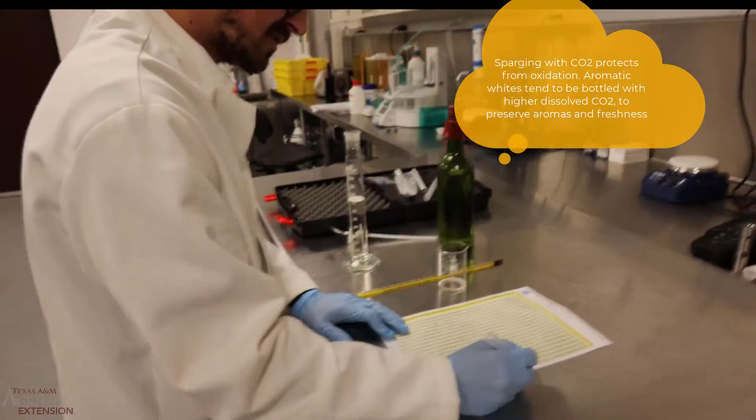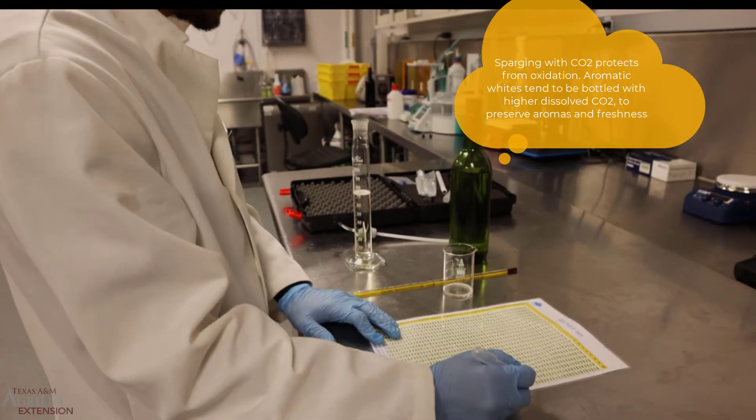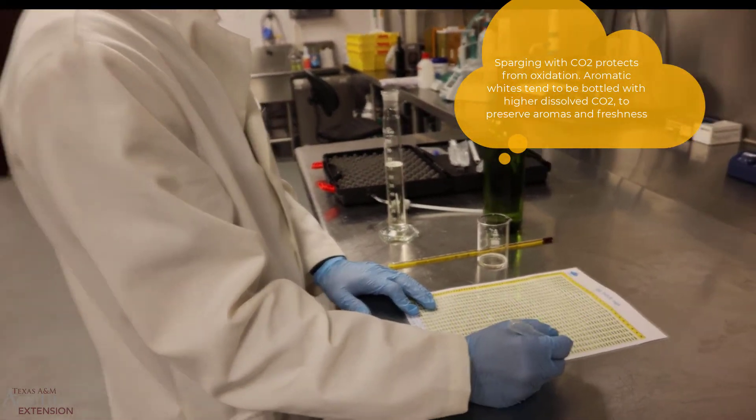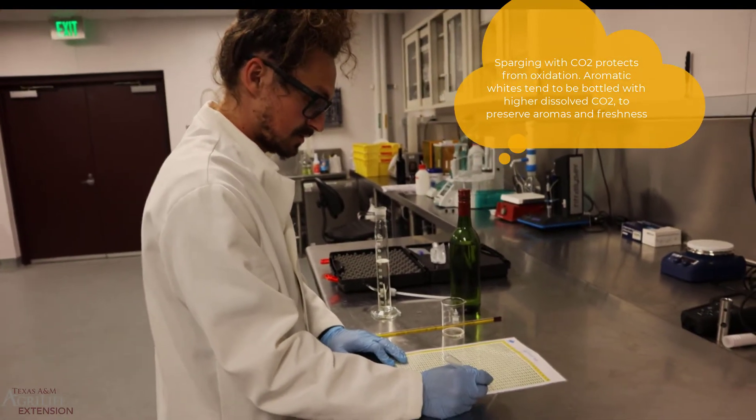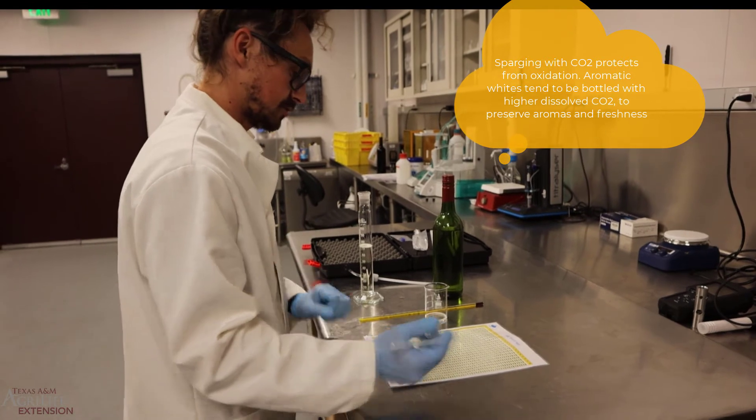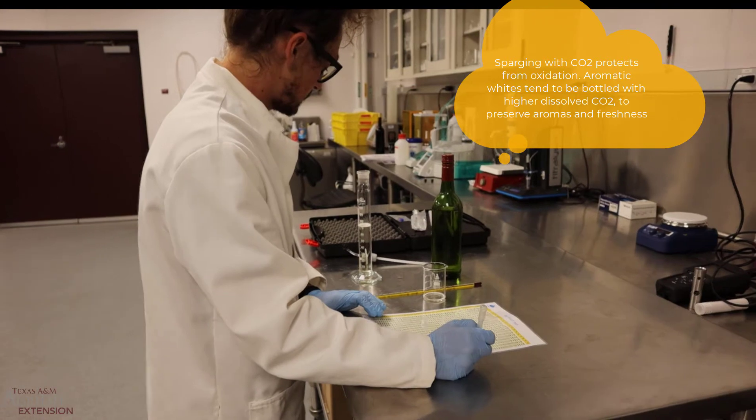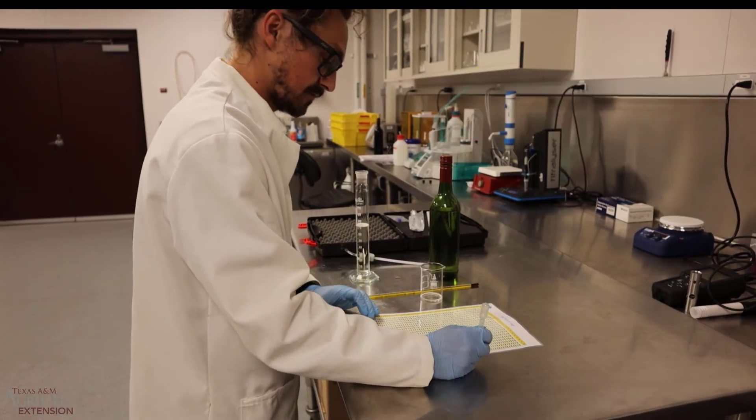For a bottle of white wine, that's a little bit high, but that will be okay since this wine is a nationally marketed wine. It comes from overseas. So it helps prevent oxidation of the wine and helps keep the wine fresh.